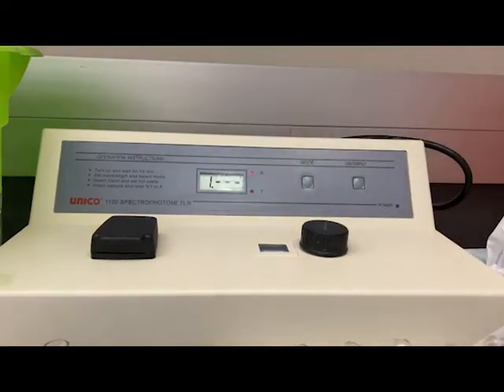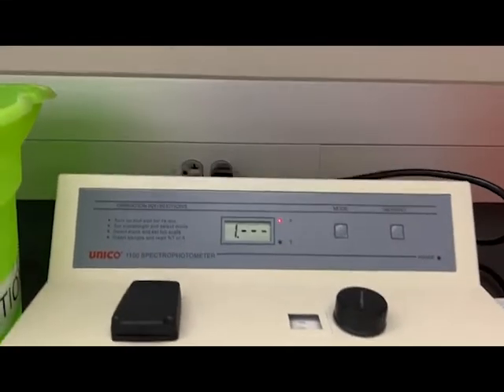Usually you want to be in absorbance mode, so we're going to stay in that. The first thing we do when we use the spectrophotometer is make sure that we're on the correct wavelength.